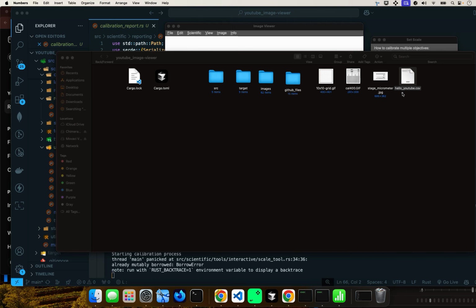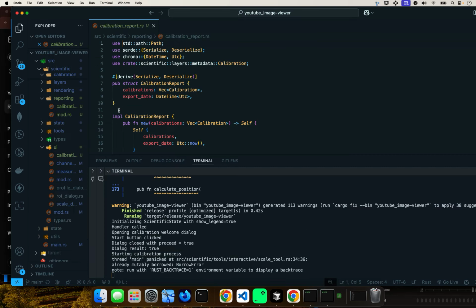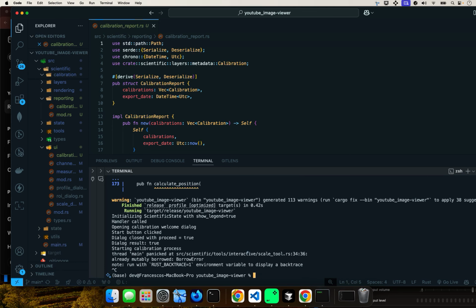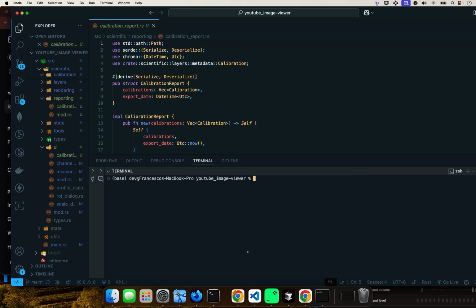And now I'm going to show you how to do that. So let's get into the code. Basically, I have a couple files here. I'm just going to do clear first, just to get it out of the way. And let's do a git status.